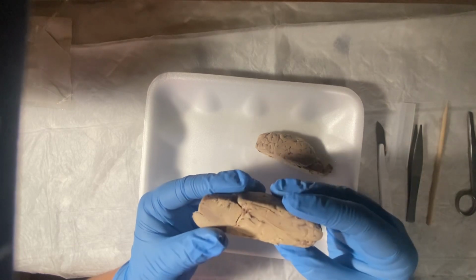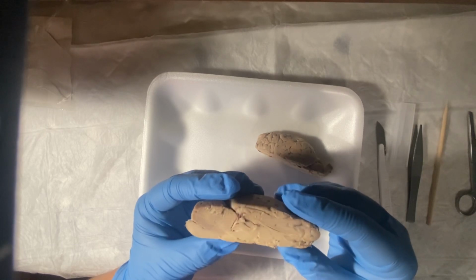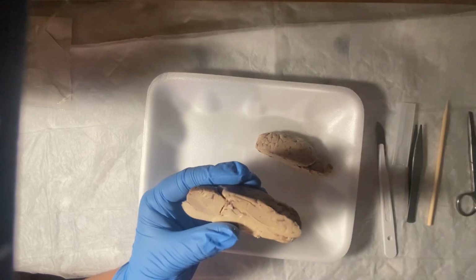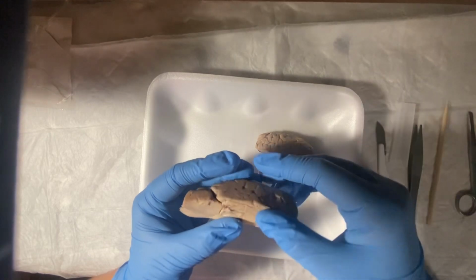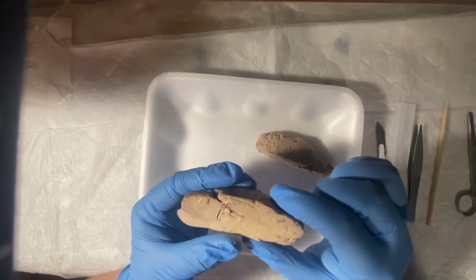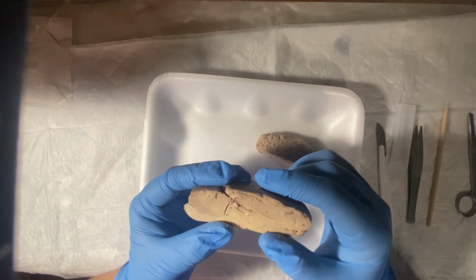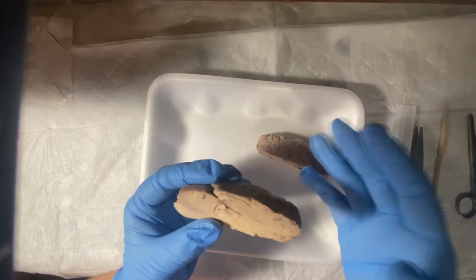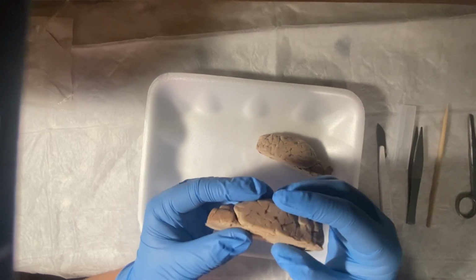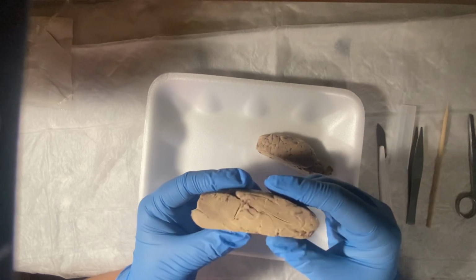Okay, and so after that, we'll go to the superior colliculus. Yes, colliculus, and that is just the midbrain portion that coordinates the movement of the eyes. Oh, so like the reflexes to light stimulus. And basically, I'm trying to find it.